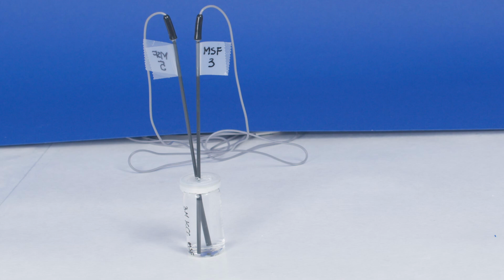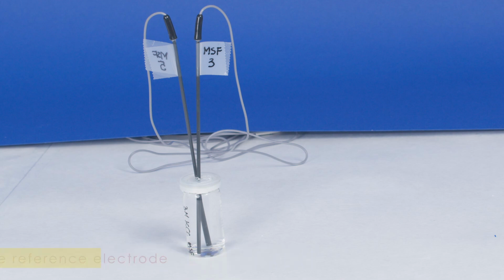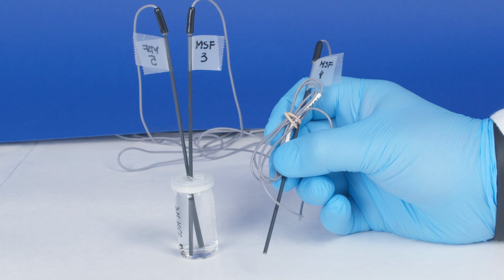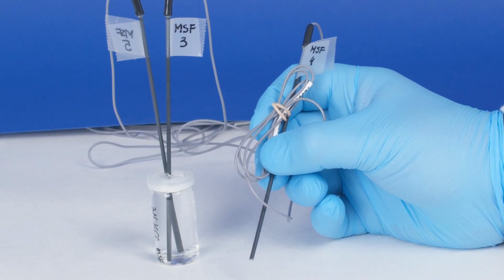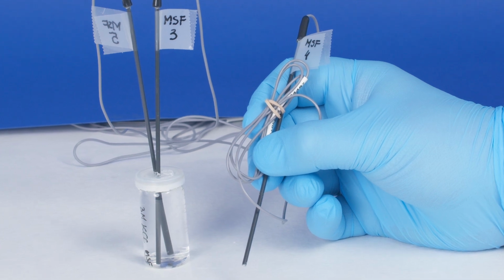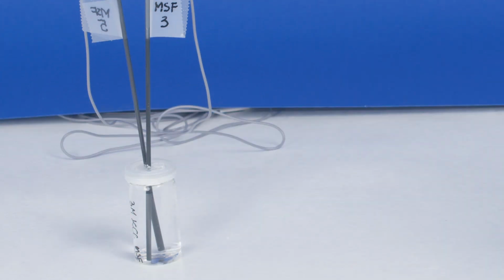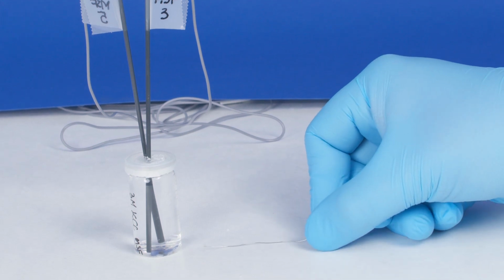Another thing to consider is the choice of the reference electrode. There are specialized reference electrodes commercially available. For example, this one is an Ag/AgCl reference electrode in a gelated 3 molar KCl in a plastic body of only 2 mm diameter that is suitable for placing directly into the microfluidic channel. Should you need a cheaper option, you can use a simple tungsten wire. Just keep in mind it is pH sensitive.